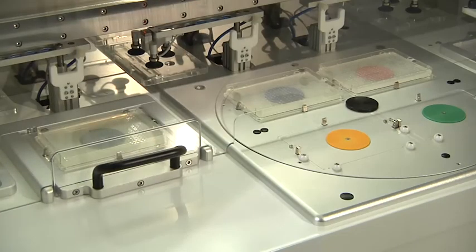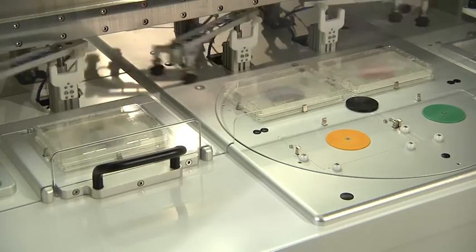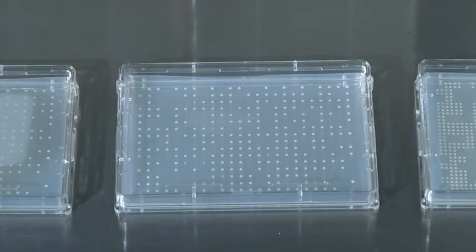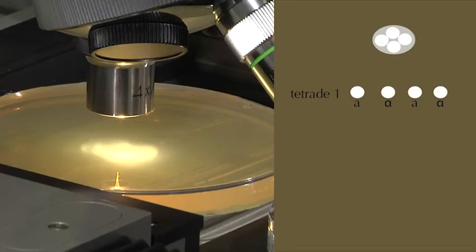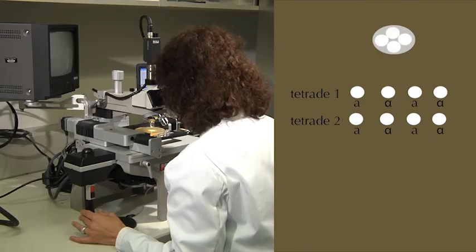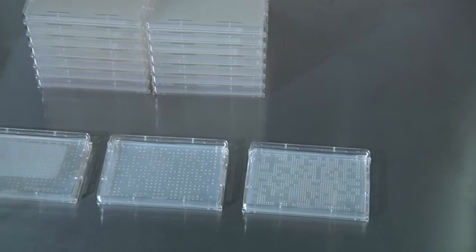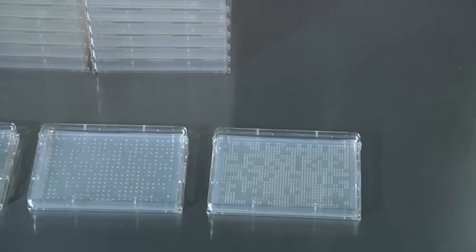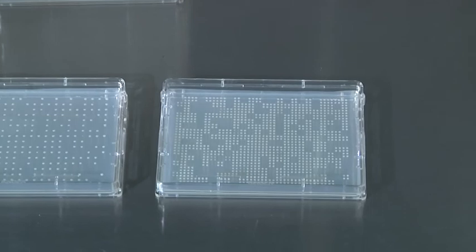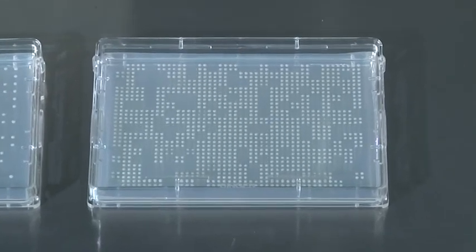After overnight growth, the mated colonies are transferred to a selection plate, which allows only mated cells to survive. Finally, we have produced an ordered array of double mutants, and we can assay them for defects in growth and cell survival. Thus, we can identify important genetic interactions which lead to cell death or growth inhibition when disrupted.